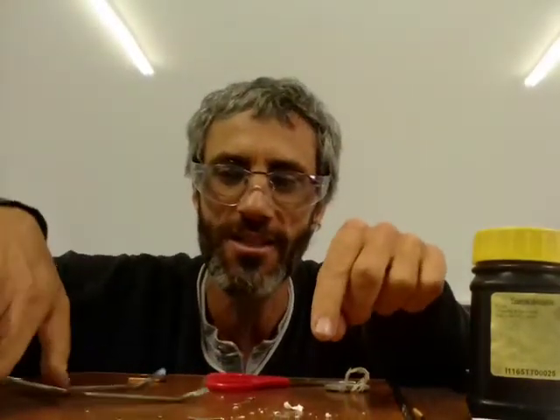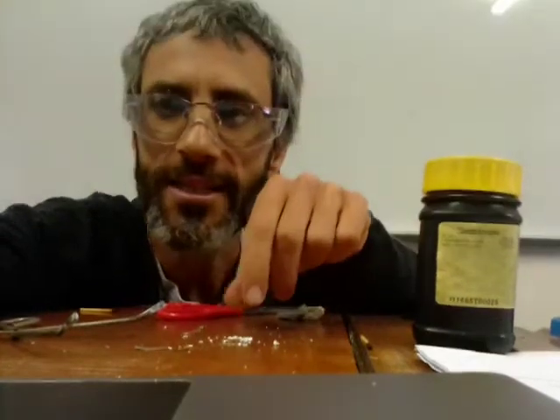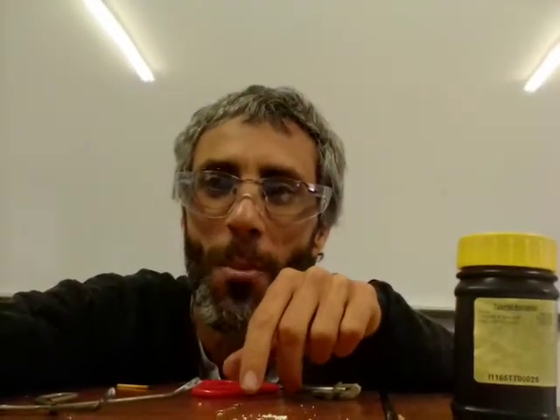You can actually touch it. I'll just show you a little bit closer. You can see this powder here. Right? You can crumble it. This is not magnesium anymore. Magnesium reacted with oxygen to form magnesium oxide. Okay, so we're going to pause here.